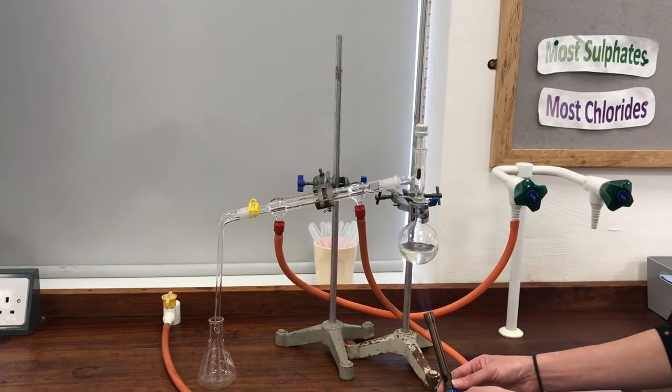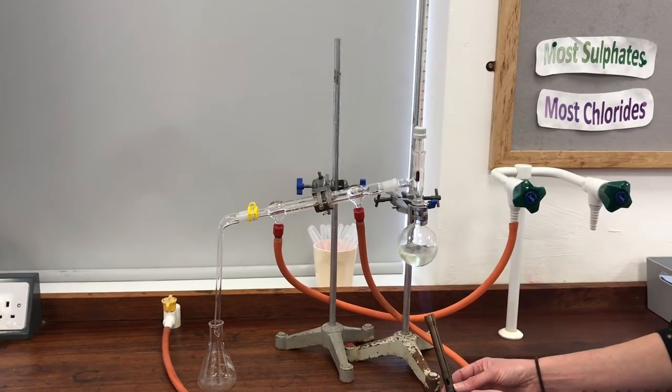and you can see that it's just starting to boil. That's only the ethanol component that's boiling.